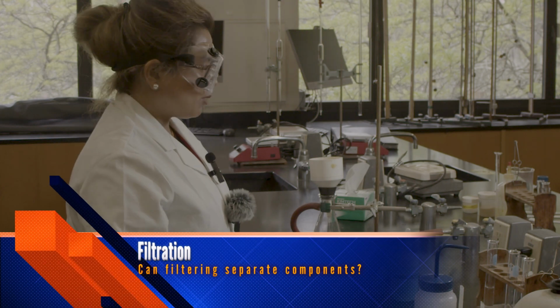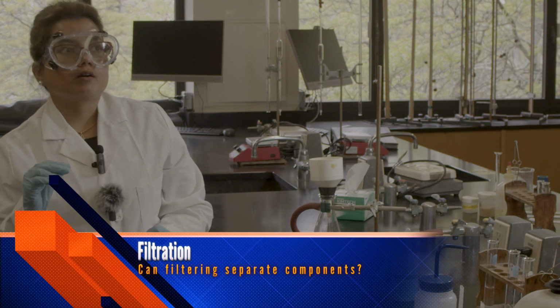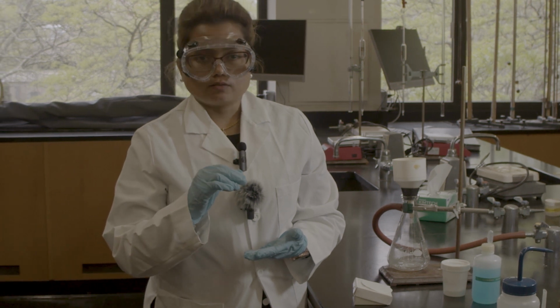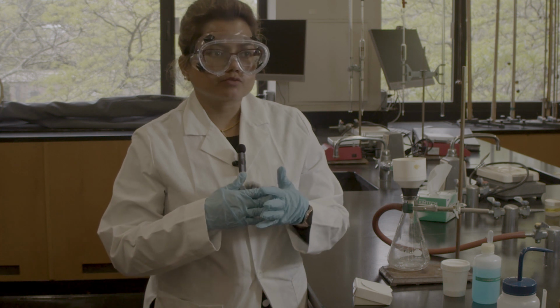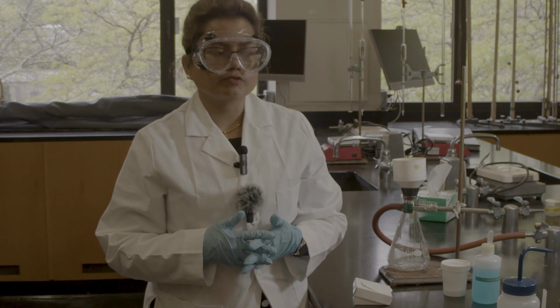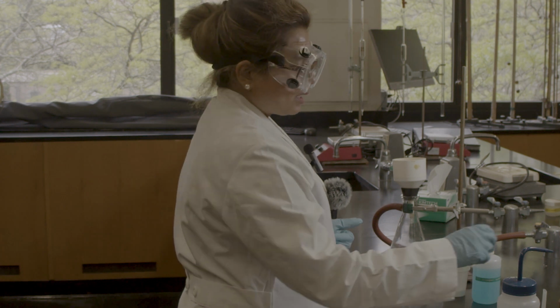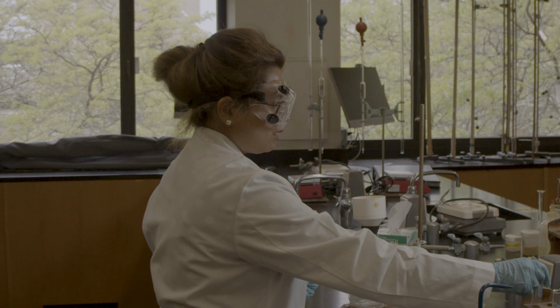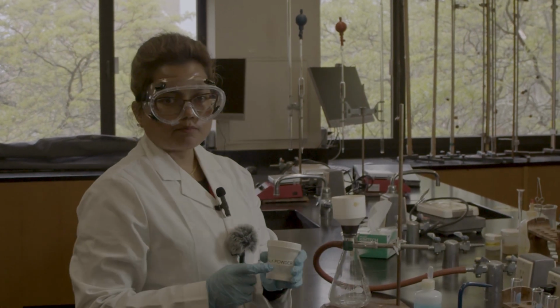So group 1 is about filtration. We can do gravitational filtration if any particle or molecule is insoluble. If it is a true solution that is homogeneous, we cannot do the filtration, as we saw before with the dialysis. So for this filtration experiment, we will use water and chalk powder.